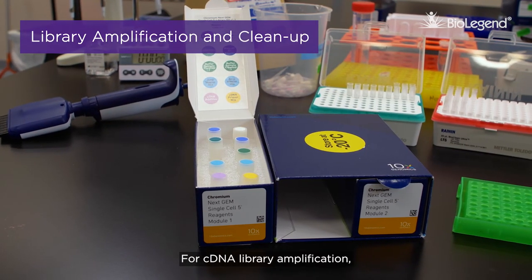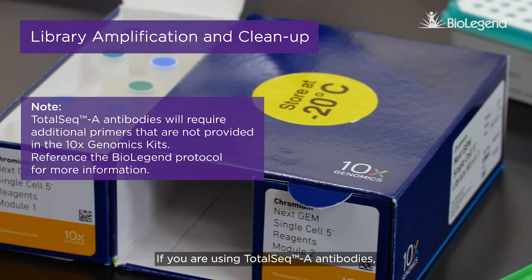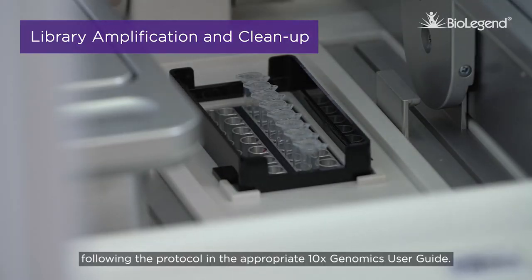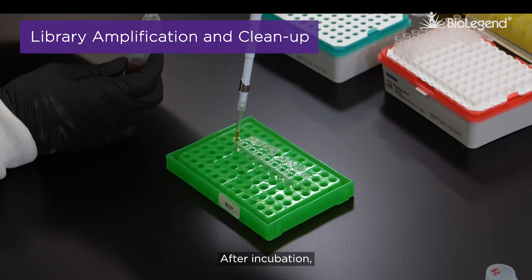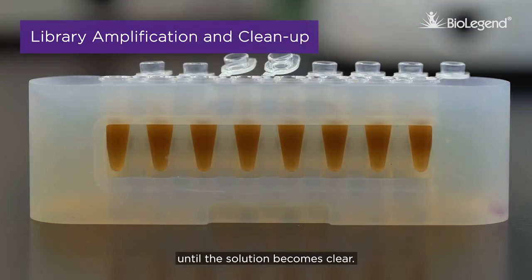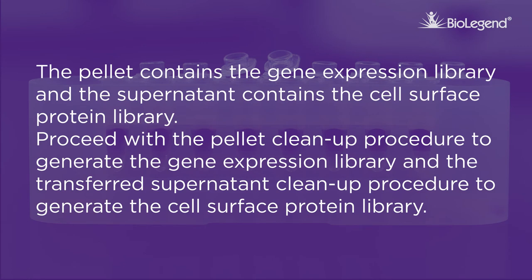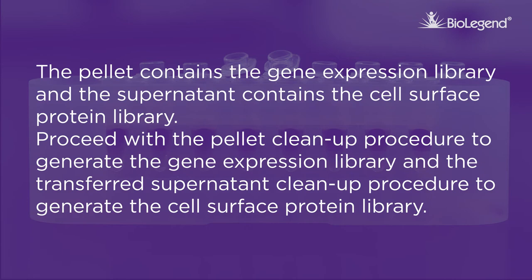For cDNA library amplification, prepare the amplification mix with primers provided by 10x Genomics. If you are using TotalSeq-A antibodies, additional primers will be needed. Incubate in a thermal cycler following the protocol in the appropriate 10x Genomics User Guide. After incubation, clean up the cDNA using SPRI Select Reagent. Place the sample on a magnet on high until the solution becomes clear. The pellet contains the gene expression library and the supernatant contains the cell surface protein library. Proceed with the pellet cleanup procedure to generate the gene expression library and the transferred supernatant cleanup procedure to generate the cell surface protein library.